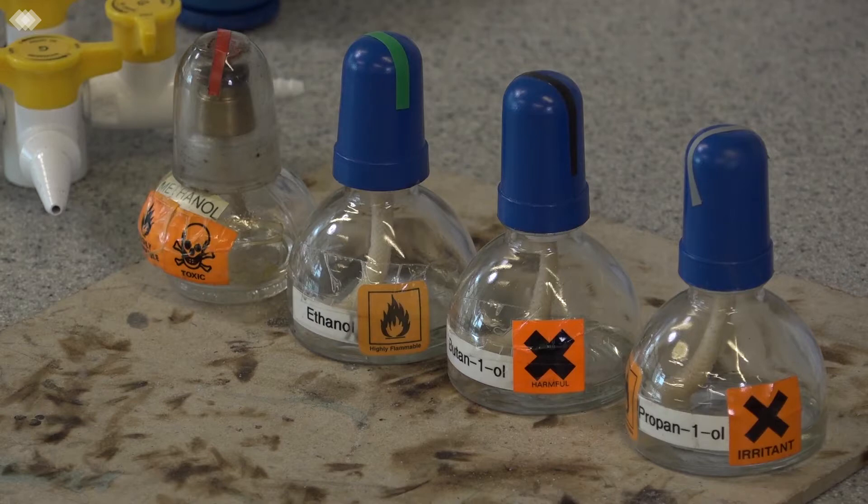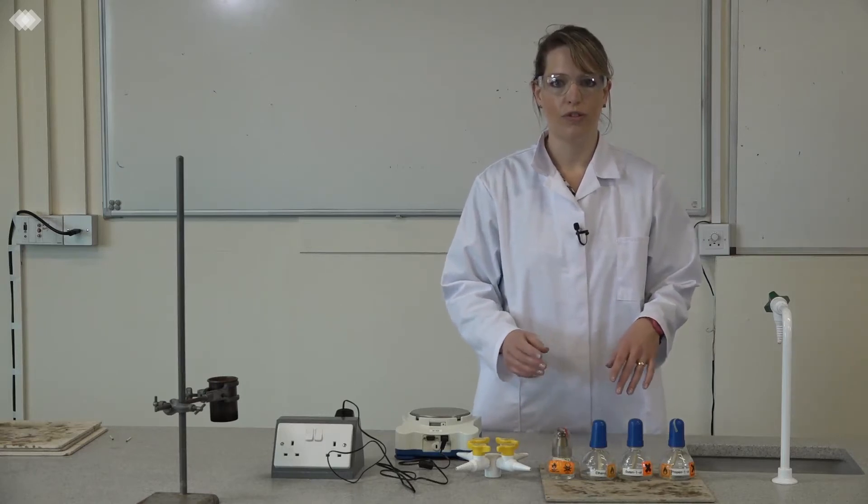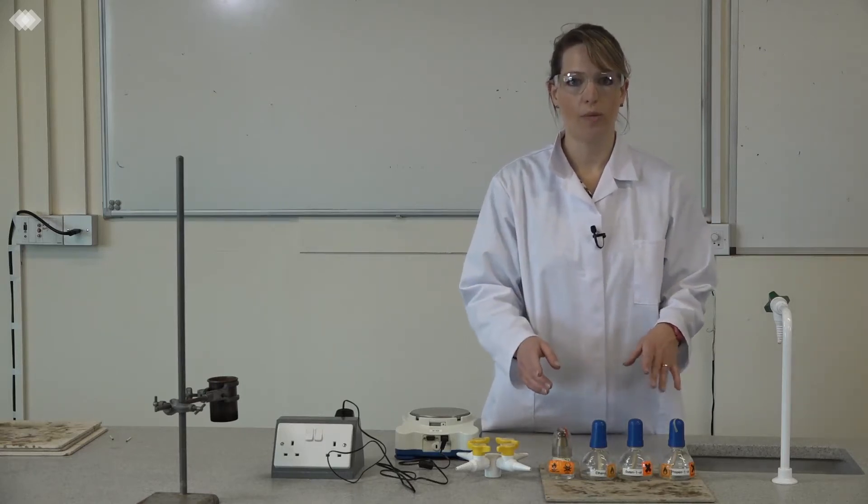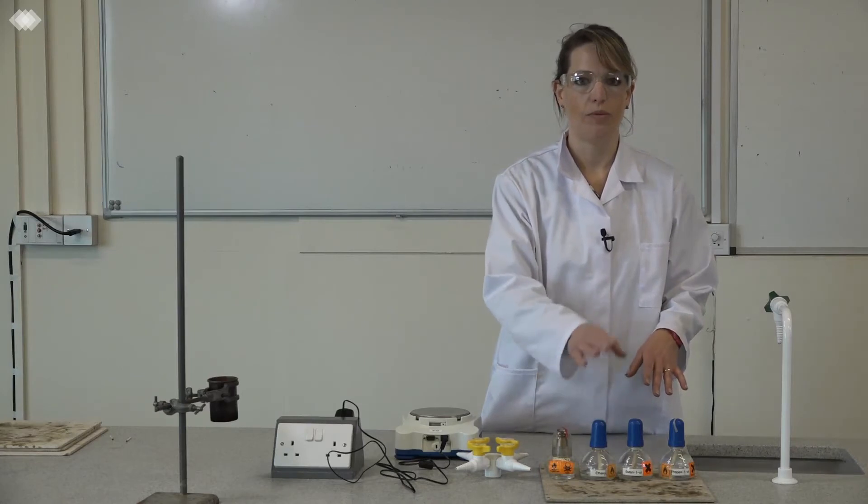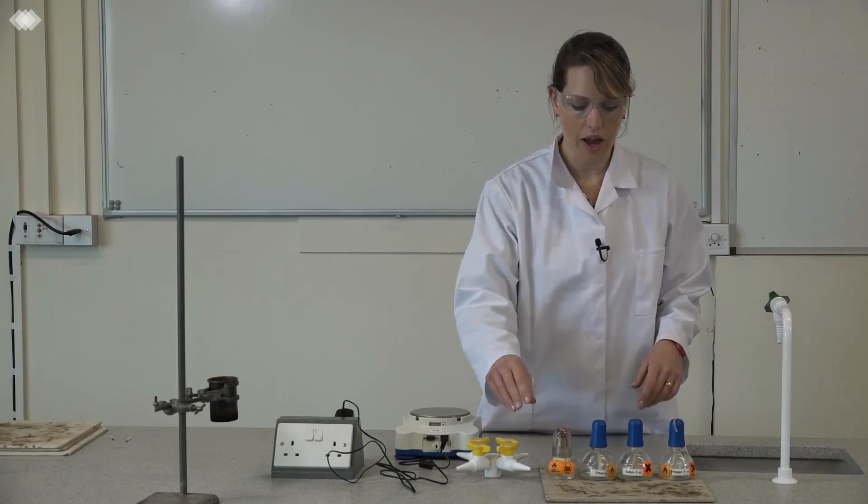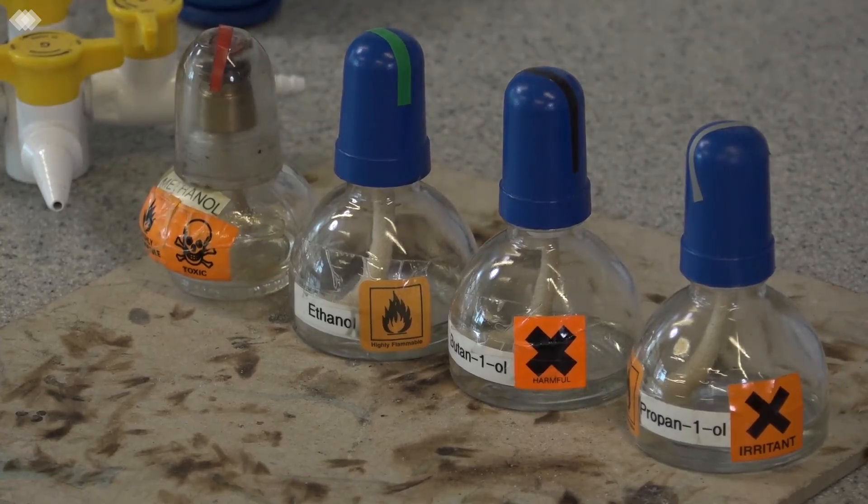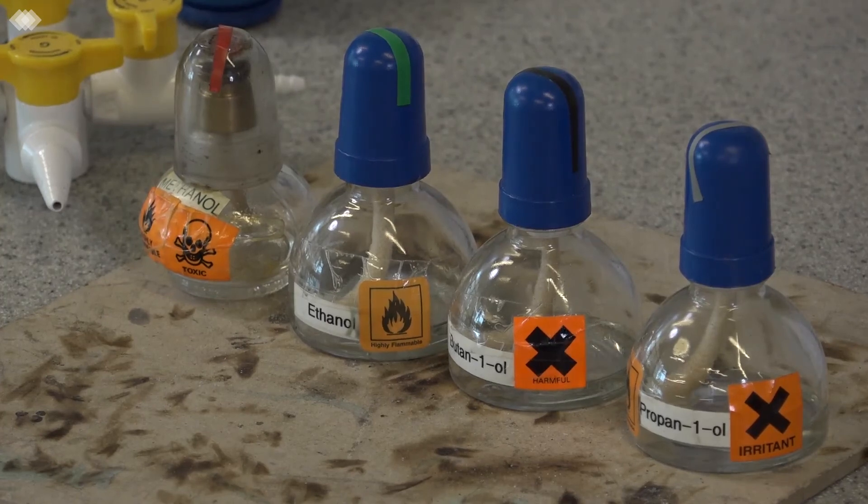Repeat the experiment with four other alcohols. It's useful to use four or more different alcohols so you can make a comparison between the size of the alcohol and the amount of energy that it contains. Here we have methanol, ethanol, butanol and propanol, but you can use pentanol as well.